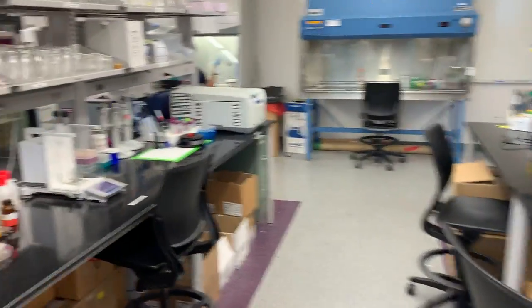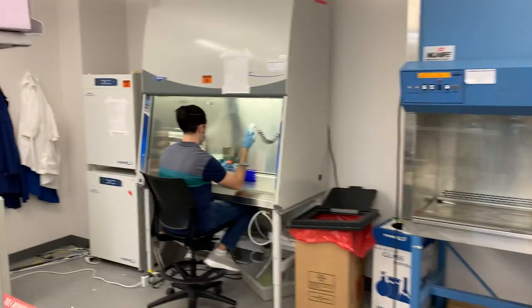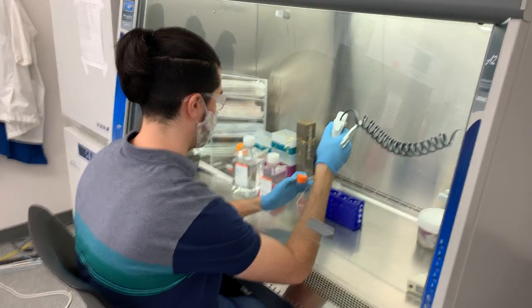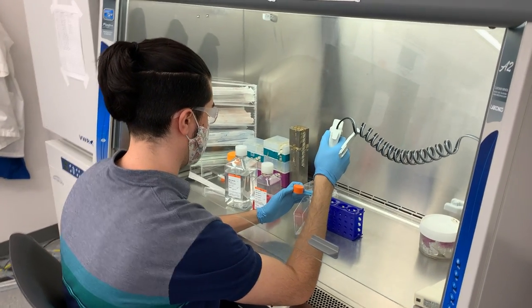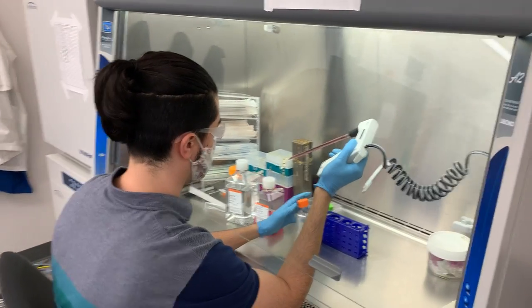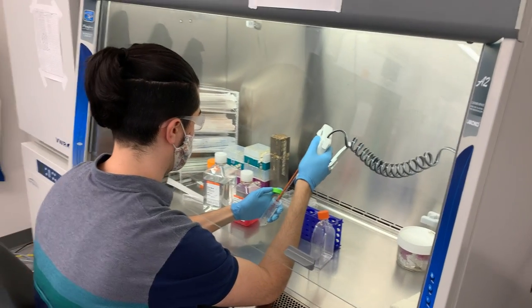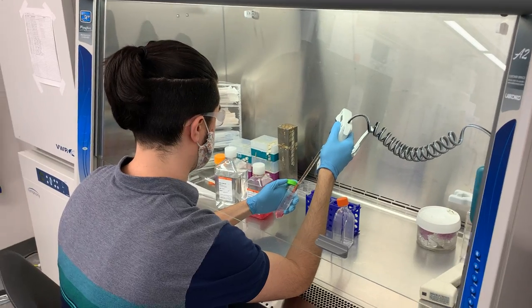We culture the cells and then we go over to the lab to see Ali, one of our graduate students, who is currently culturing cells. Ali is culturing suspension cells, specifically multiple myeloma — a type of cancer that affects the immune cells. Ali's project is focused on developing peptide-based biosensors to evaluate enzyme activity, but that occurs in very, very small volumes so we're not able to show you that directly.